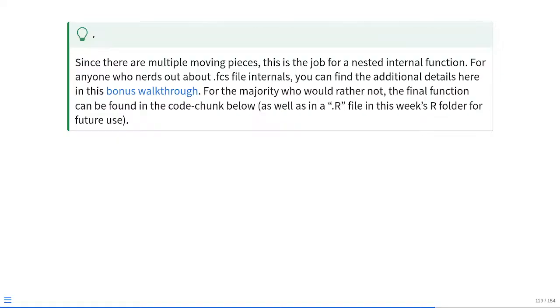Since there are multiple moving pieces, this is clearly an area where you need nested internal functions to carry out the job. For anyone who nerds out about FCS file internals and wants to see the additional details, there's a bonus walkthrough. We recorded that one on Tuesday as well, so it's in video format too. But for the vast majority of you who'd rather not dive into the process of converting a raw FCS file's metadata to the correct unmixed FCS file's metadata, the code is just included in the code chunk below, and that function is also included as a .R file within this week's R folder so that we're able to use it again in the future.